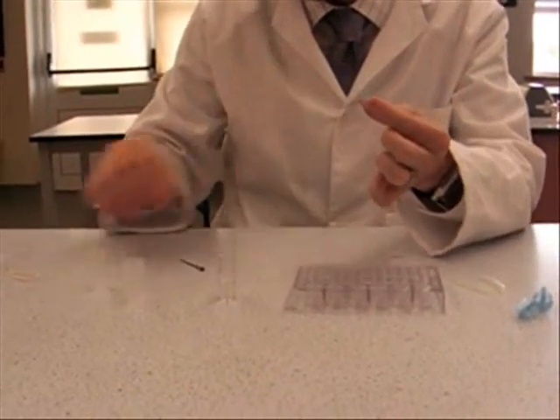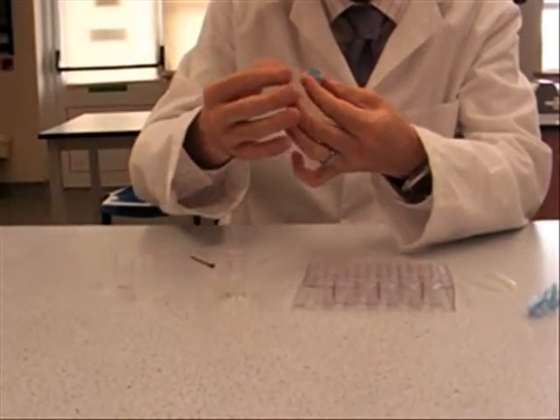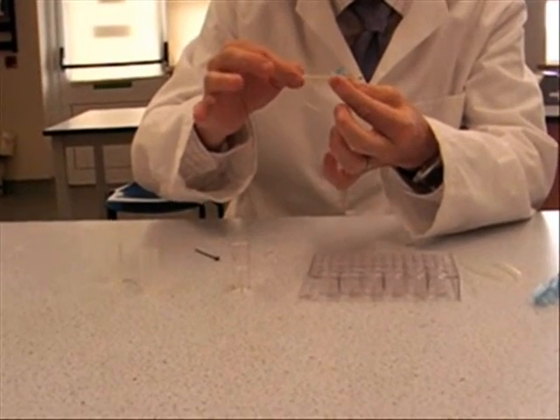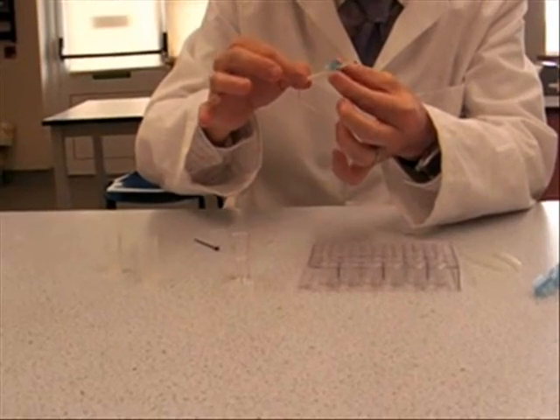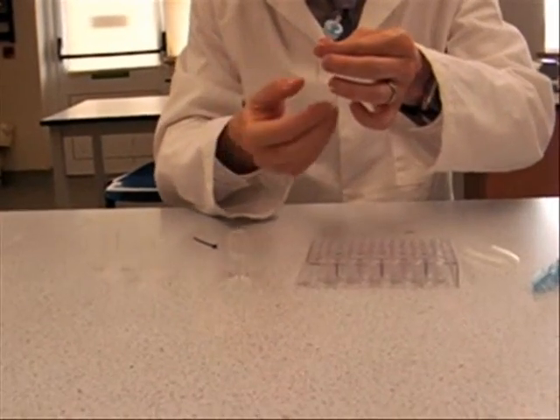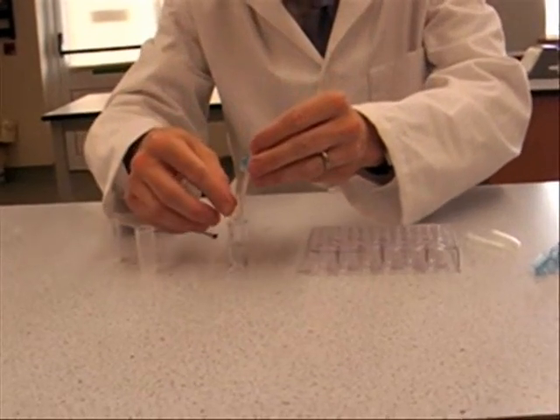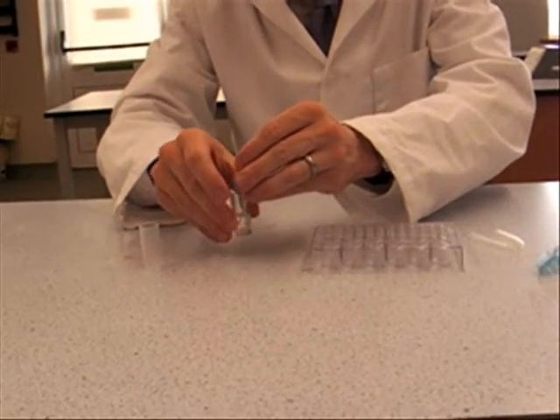It's got a glass tube in which you're going to run through the wick. And you'll need to cut this down to size, you don't want a huge, you only want about half a centimeter sticking out of the top. And the rest of it will act as a wick.